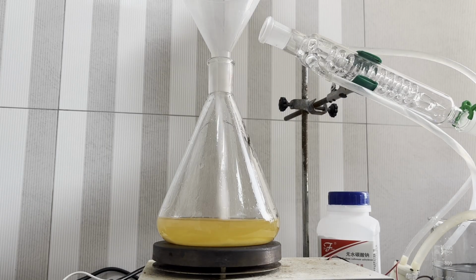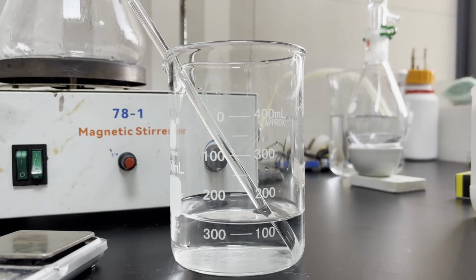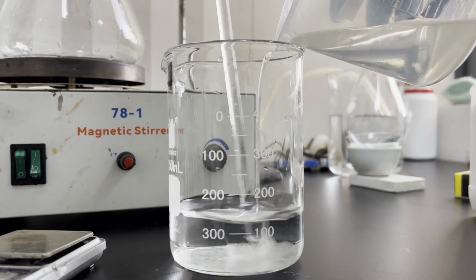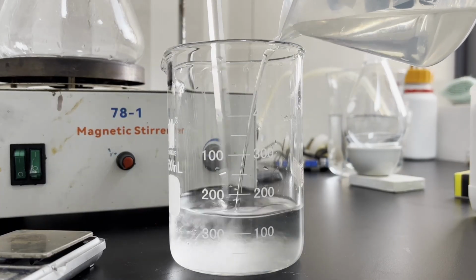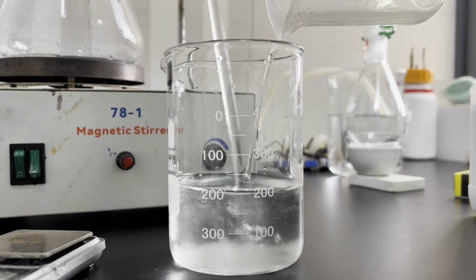Mix sulfuric acid and potassium bromide and distill over the hydrobromic acid. That's it. I first dilute around 140 grams of 85% sulfuric acid in 200 ml of water. The amount of sulfuric acid I use here is 1.21 moles, and since I plan to make 2 moles of hydrobromic acid, this is not yet a stoichiometric equivalent.